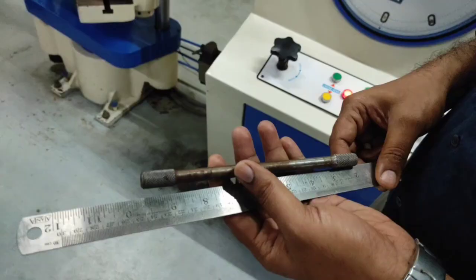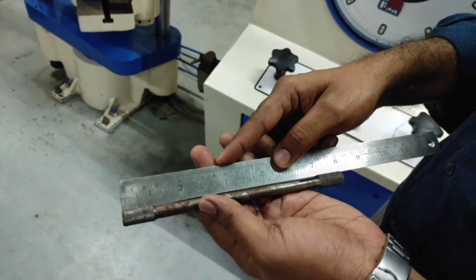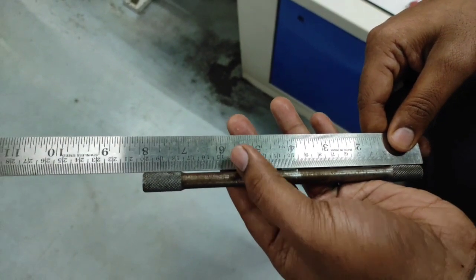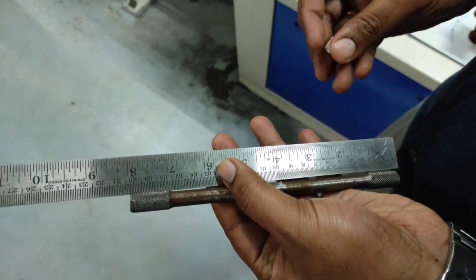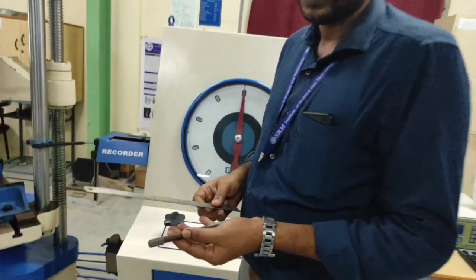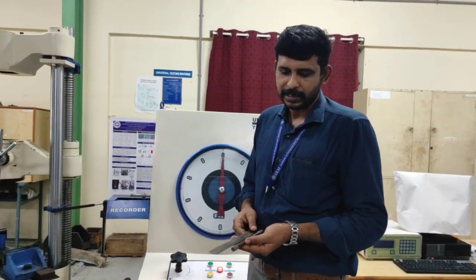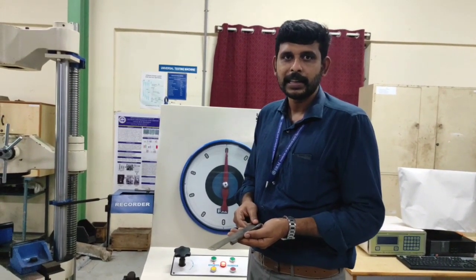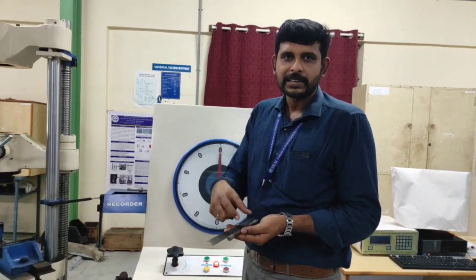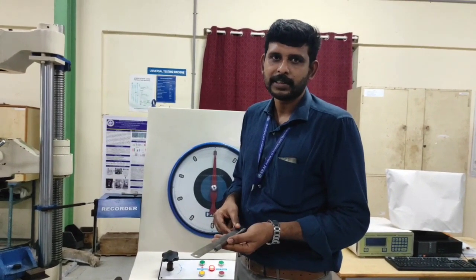Okay. Now in order to mark the actual center of the specimen, first of all measure the length of the specimen. It is 200 mm. To mark the center point, just locate the center of the specimen at exactly 100 mm. This is to make note of the gauge length of the specimen in order to fix our extensometer. The extensometer will be operable only under a gauge length. In order to locate the exact gauge length of the specimen, in which the extensometer is connected at the two ends of the pegs, we are marking the central point of the specimen.